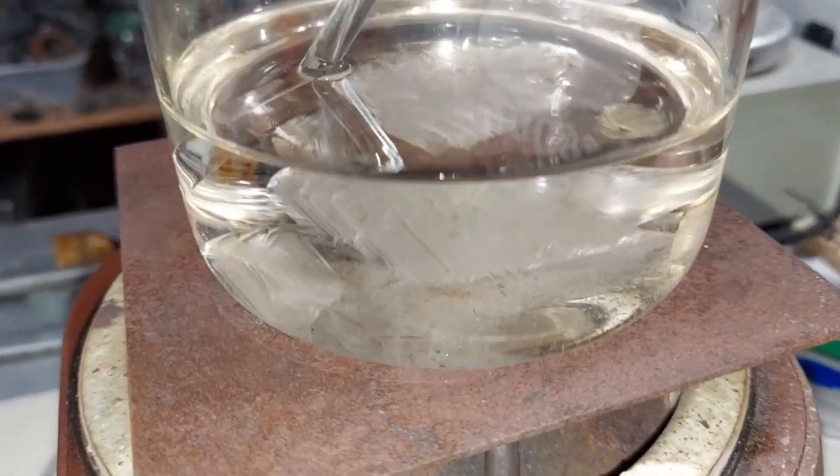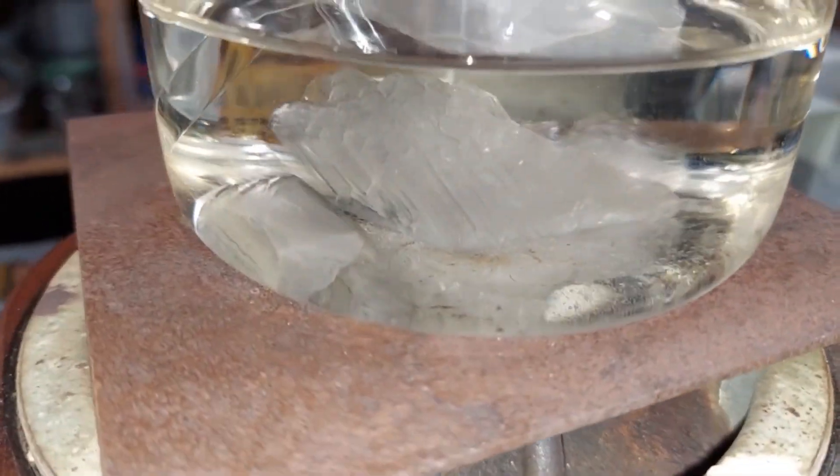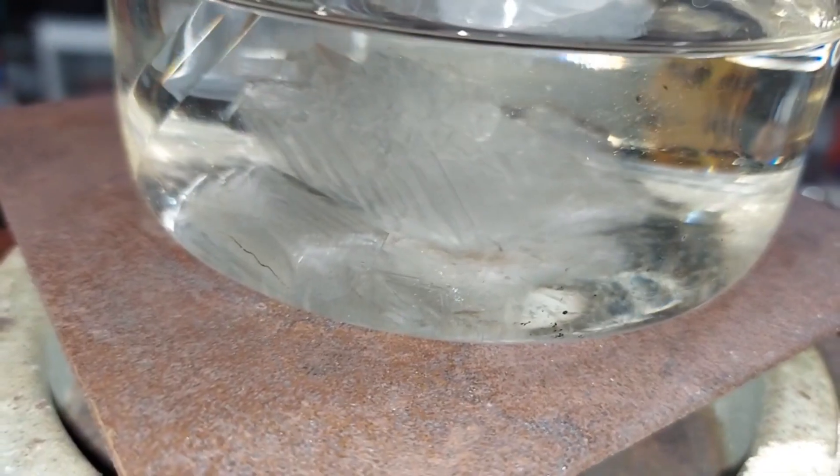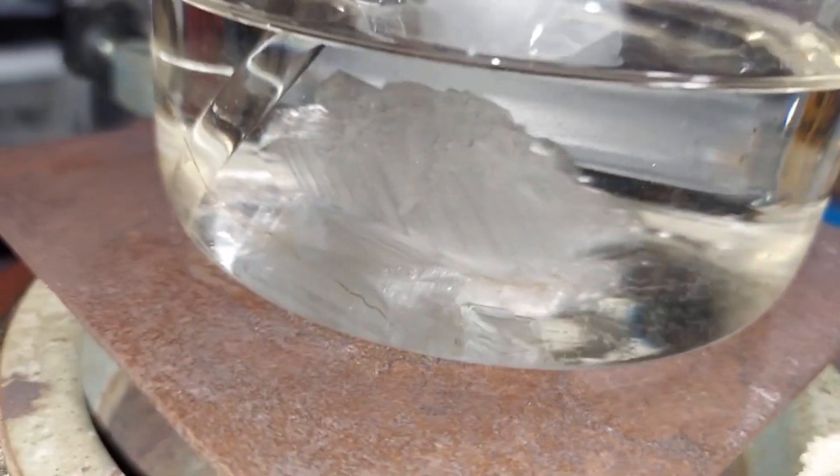Concentrated sulfuric acid here, close to 98%. I boiled this yesterday, but left it in the garage overnight.